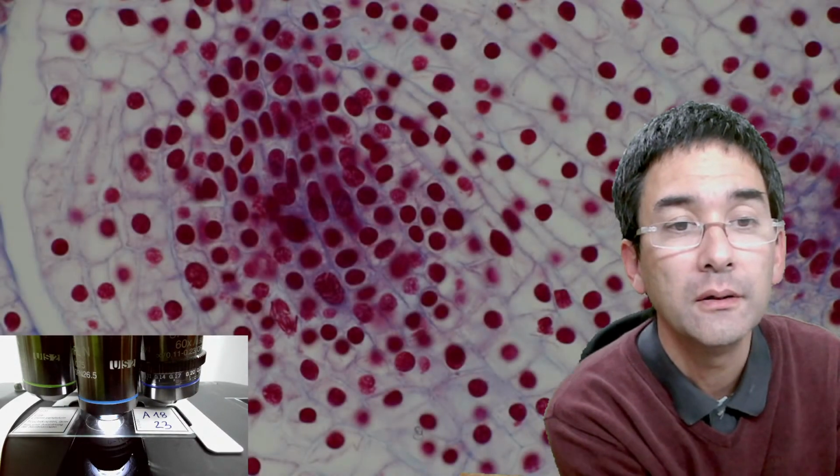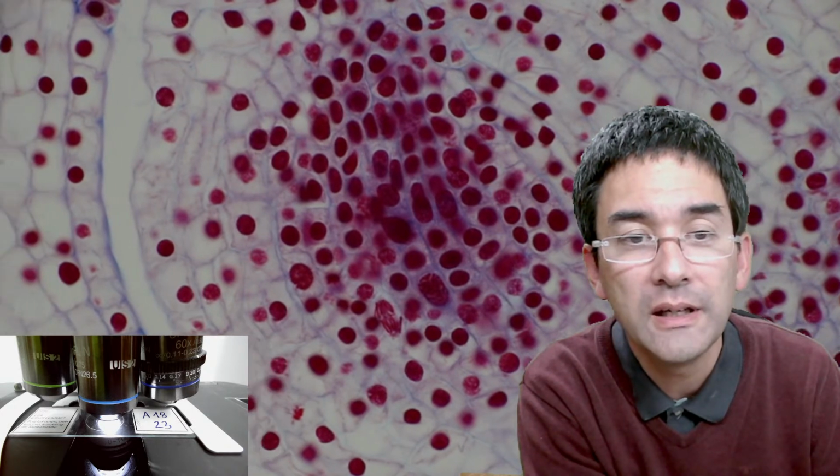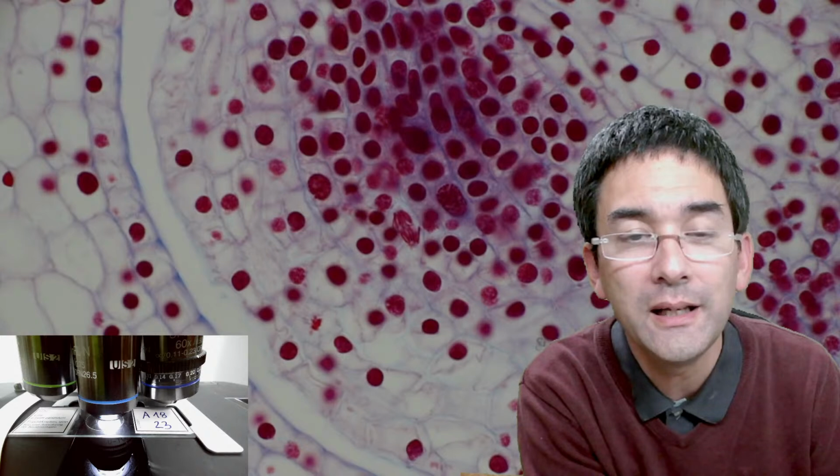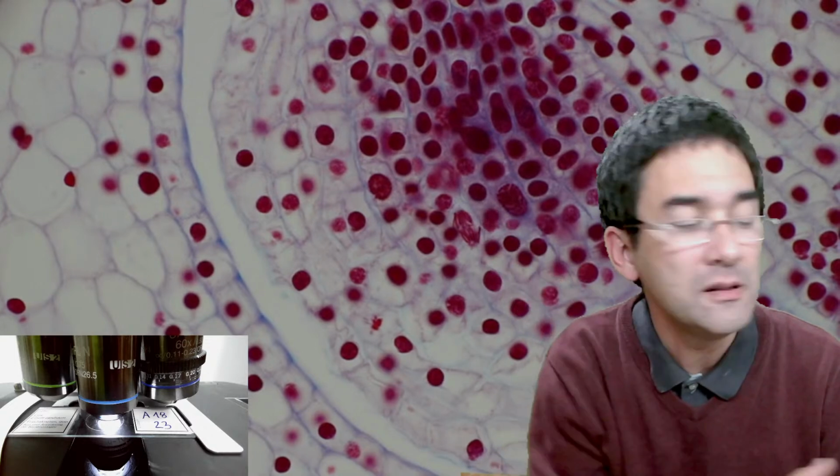So let's have a look here. Let's make it a little bit brighter, and maybe if you are a careful observer, you might already see a cell in anaphase right in the middle. Yeah, again, I'm gonna move it forward. Do you see this here? Okay, yeah, diagonally, these are the chromosomes.